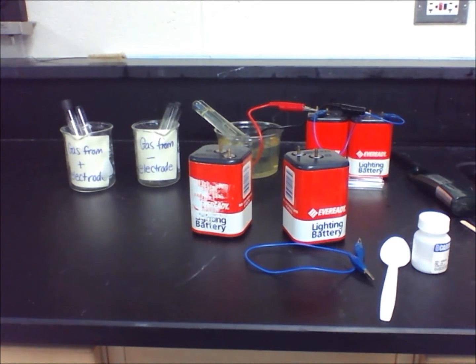In Lab 20, students use electrolysis to separate the compound water. Water is made up of two different elements, hydrogen and oxygen.